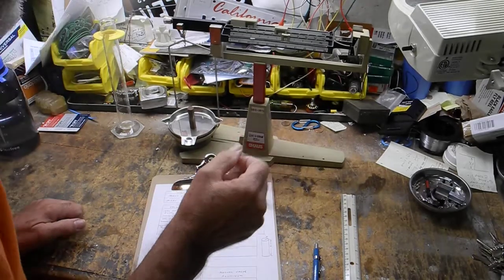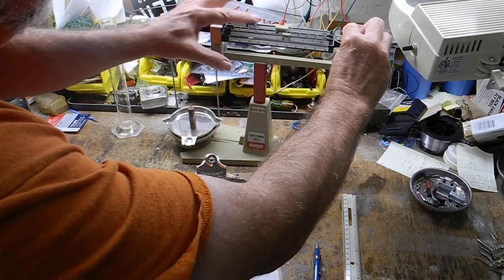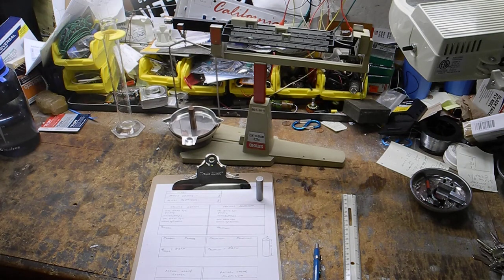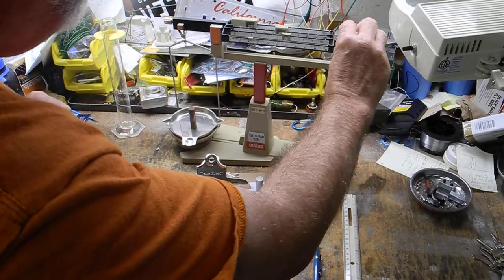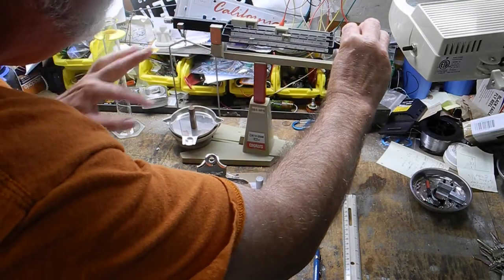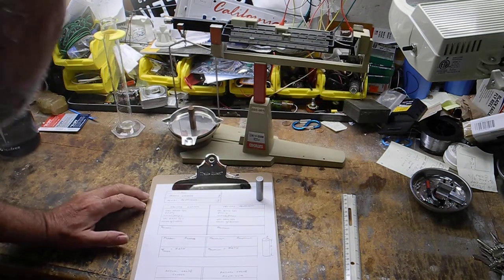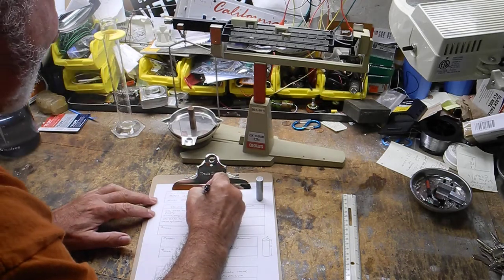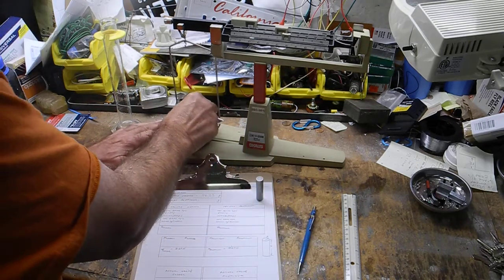So we're almost on zero. What I like to do when I do this, it's a little heavy, so I'm going to slide this back. I like to hold it so it doesn't jump around on me too much, and just scoot it back like that and let it go. We're pretty close to 56 grams. I went too far. I'm darn near close. It's probably just move this to the next little line right there, and we're good. So 56.23 grams. I'll do aluminum, and then I'll hold this up so you could see them both.